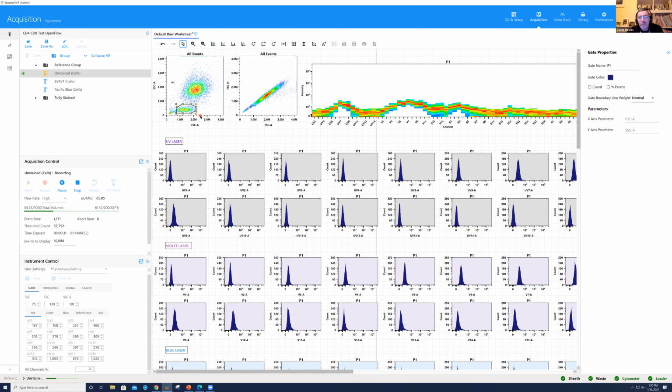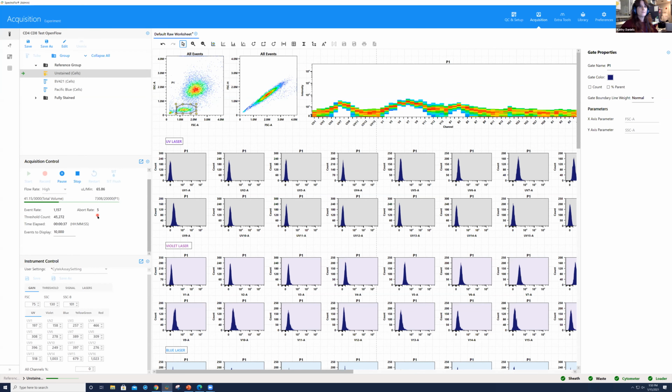So Kathy, that abort rate, is that the actual cell number or is it percentage? Another question here from Jim. That's the cell number. Okay. Yeah. So we'd have the same considerations as, again, a conventional flow cytometer about the pressure that we apply. We don't want to go too fast because we'll see more spread of the data.